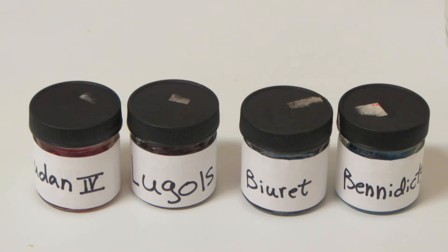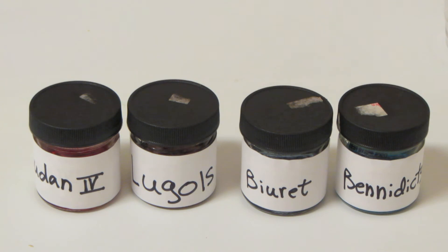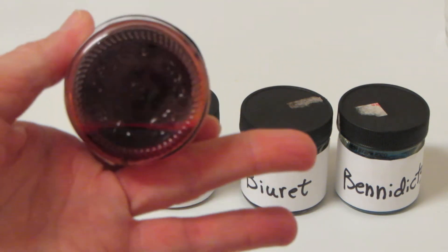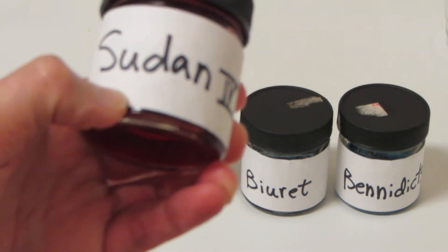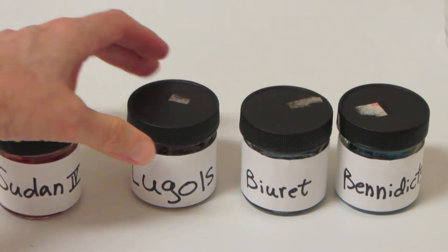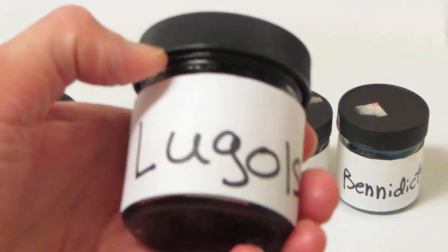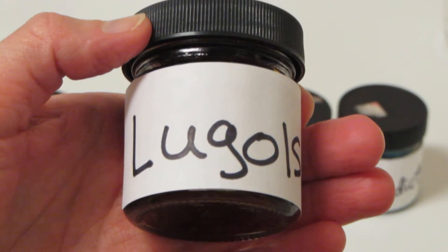We have four solutions sitting here on the counter that are typically used to identify these molecules. The first one is Sudan 4 — this one is magenta in color, and this is the one we use to identify fats. The second one, Lugol's solution, is an amber brown in color, and this is the one we use to identify starches.